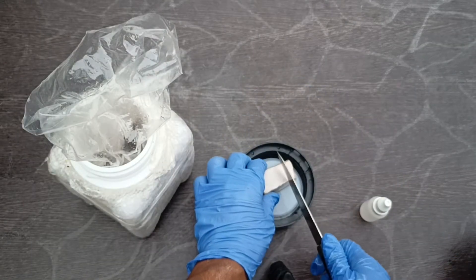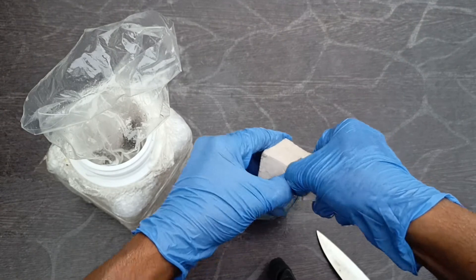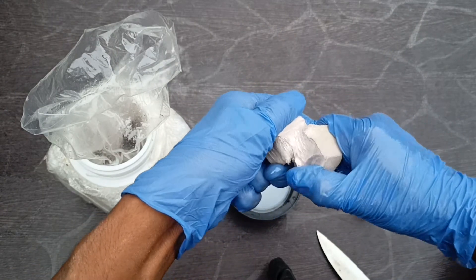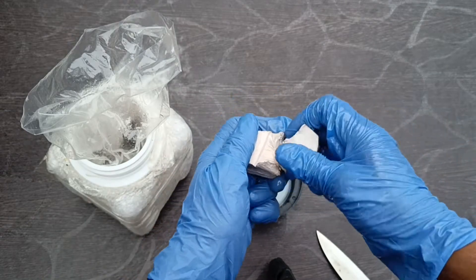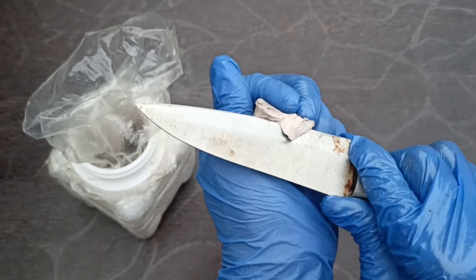Let's cut it. It will be very smooth — you can actually rip it off with your hands. Can you do the same with iron or other metals? Absolutely no. See how easily it's chopping off.